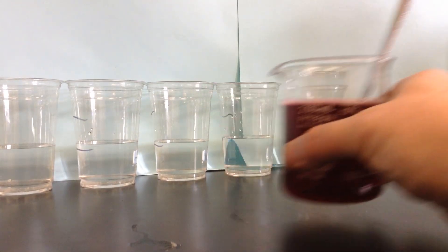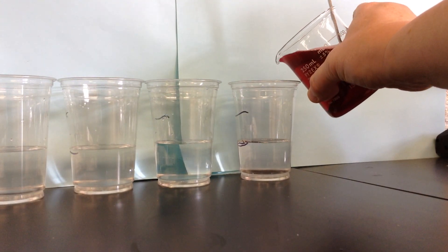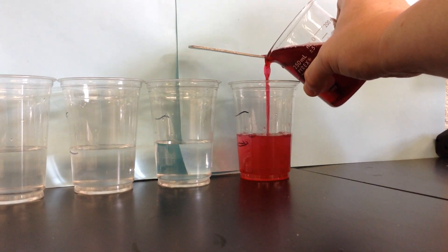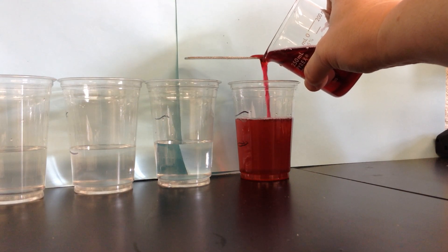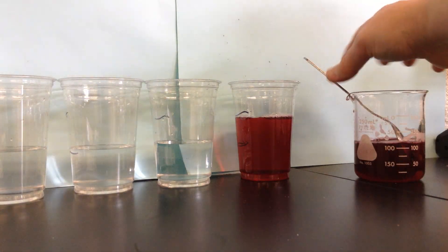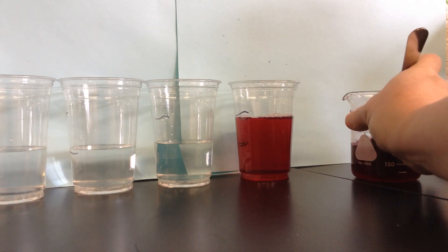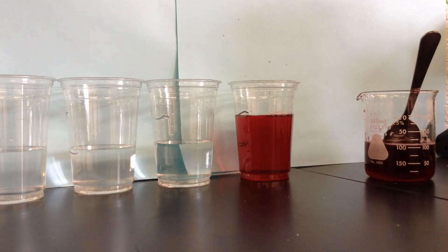I'm going to take my saturated solution and add it to the same amount of water, so I'm going half and half here. Try not to spill it because it's pretty sticky stuff. I've made a half and half solution — it was half solvent, half my solution, so it's at half strength.